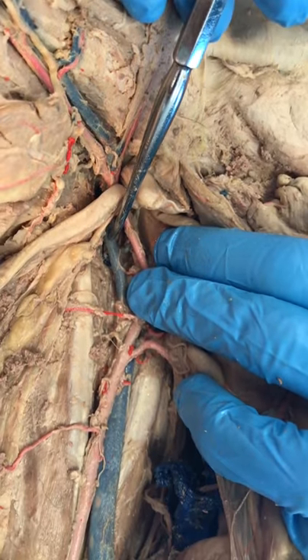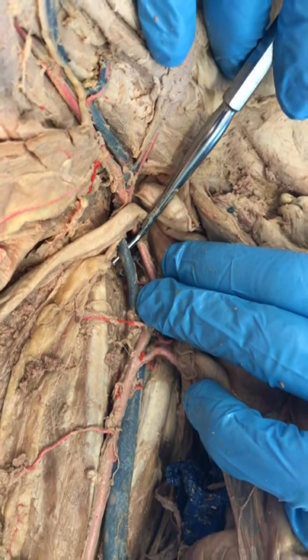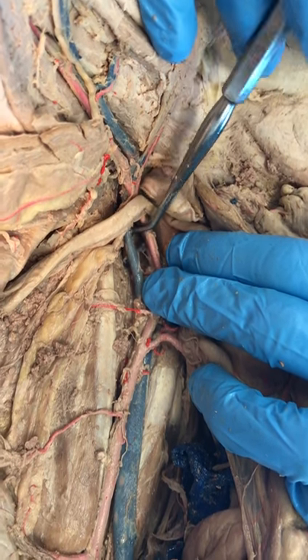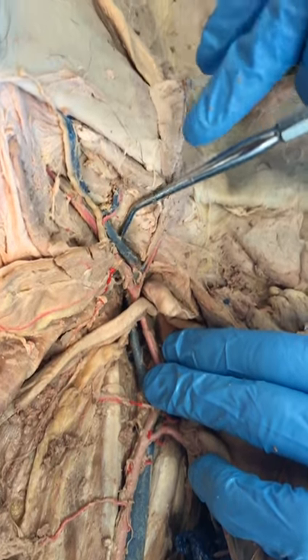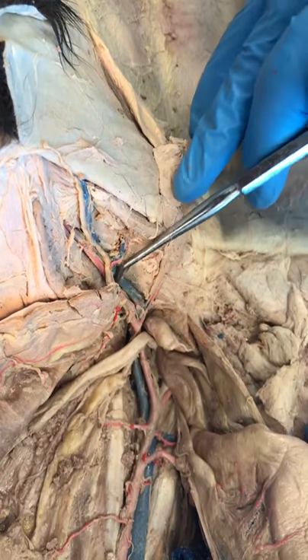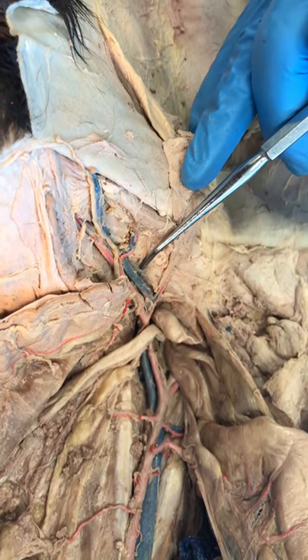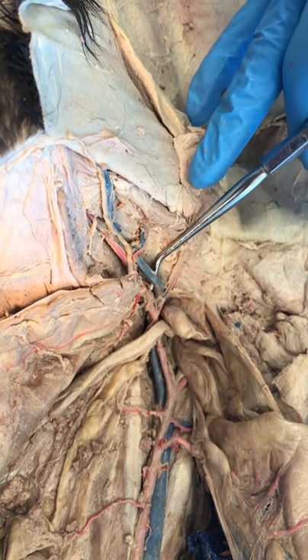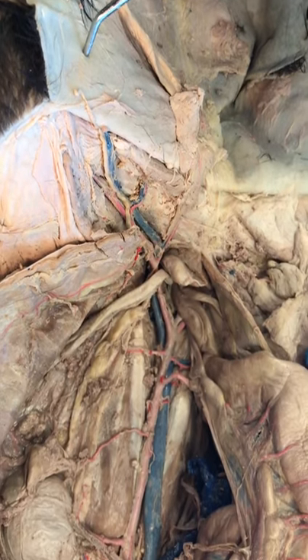This is the left external iliac vein — the big one that continues on down the leg. After you cross the inguinal ligament line, we're now in the femoral vein, running with the femoral artery and the femoral nerve. So this is the NAV complex — femoral vein. And that continues down into the leg to become the great saphenous vein.